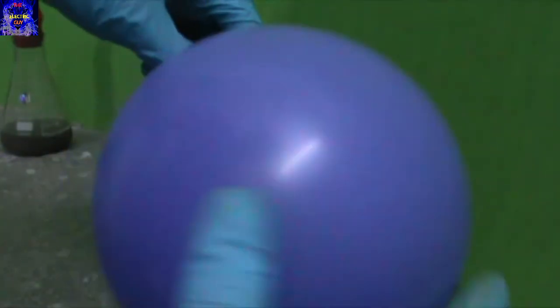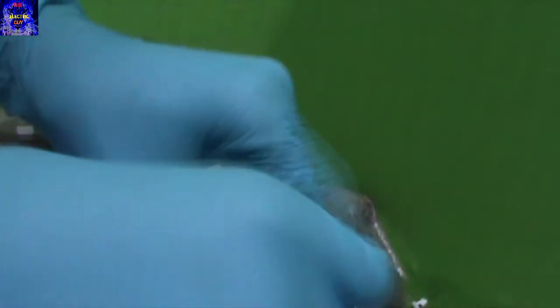After some time when the balloon is filled enough with hydrogen gas, remove the balloon from the arrangement and block its opening. I am using some tape to do so.